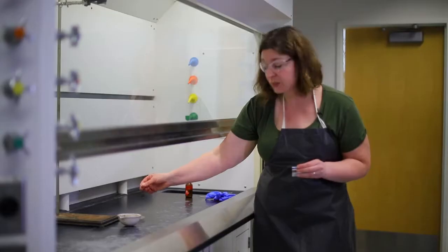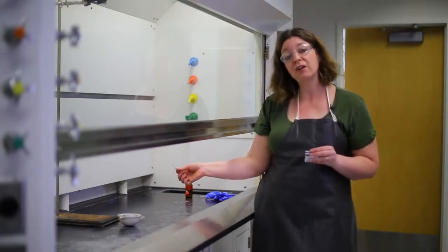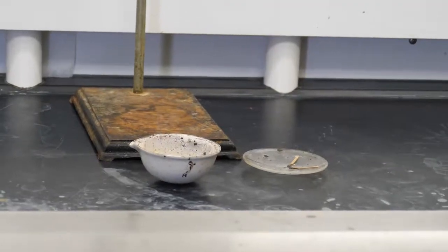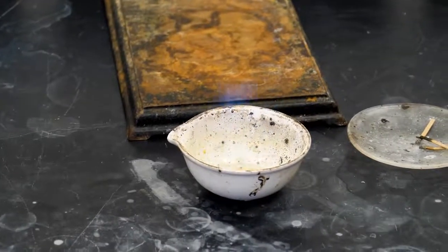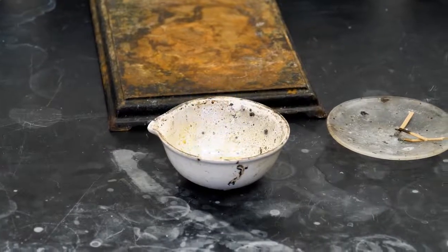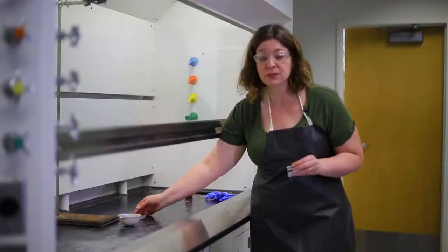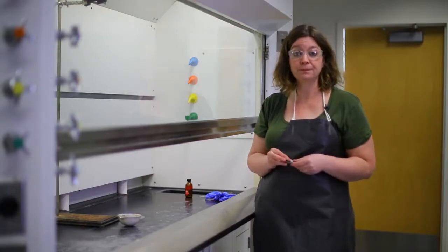So all I did was wave a heat source above the vapors in this dish and they caught fire. So this is also something to think about whenever you're handling flammable materials. Try to keep any other source of heat away from this. Keep this away from the stove, keep this solvent away from sunlight, keep this obviously away from open flame.